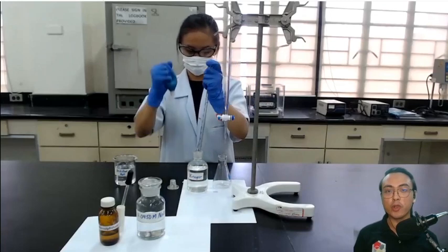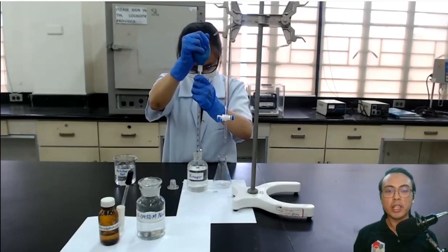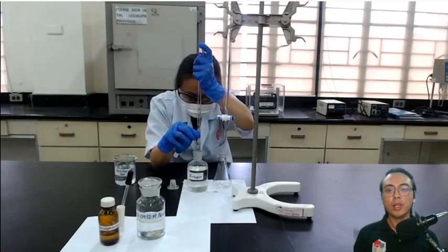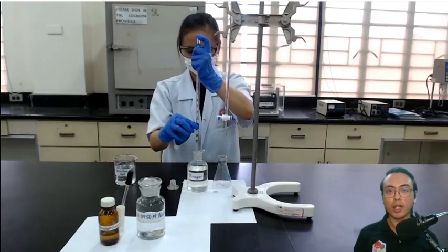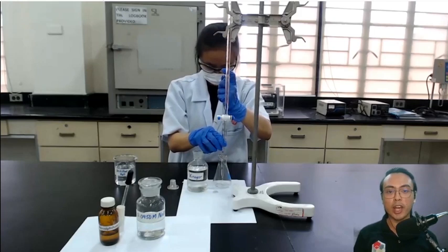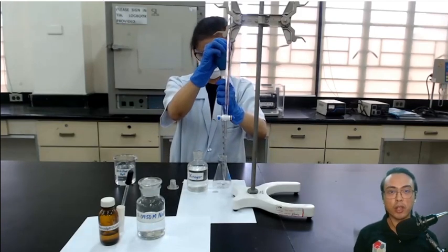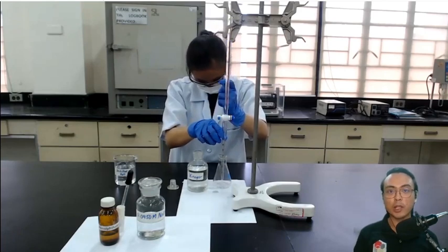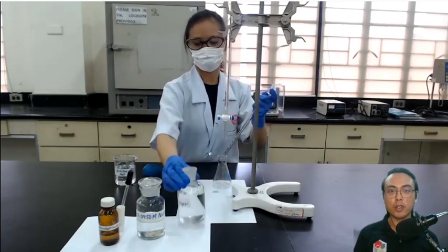With that we are ready to watch the demonstration of the titration; I will be providing commentary along the way. First she is obtaining a known volume of the vinegar sample using a pipette — the exact volume is reflected in the raw data provided in your Blackboard accounts. She is then transferring the known volume of the vinegar sample to an empty Erlenmeyer flask.